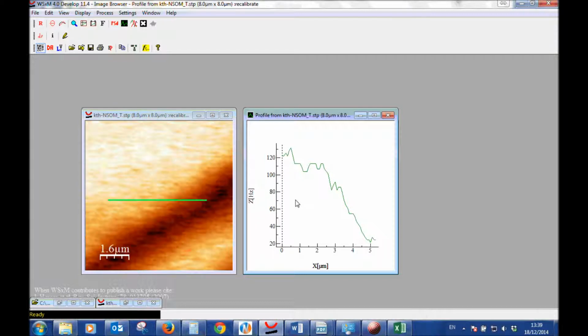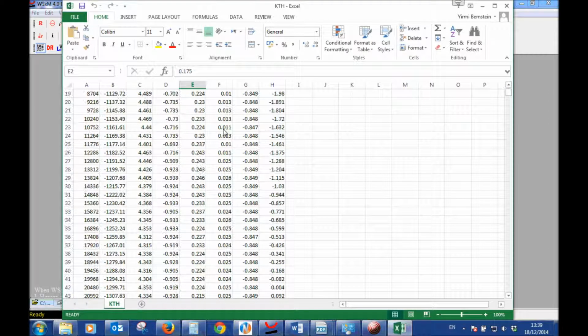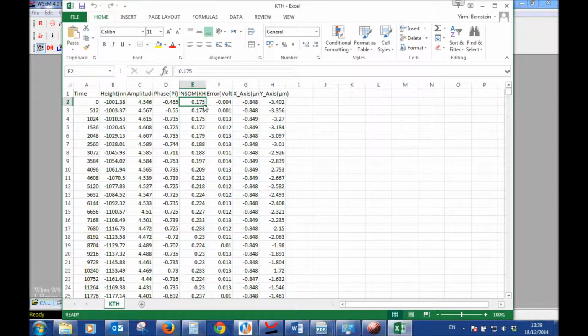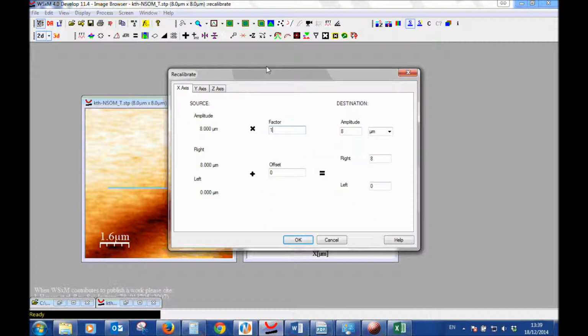Now all we did was make the minimum 0, but we want it to make more sense. So we can just look for the minimum value in this Excel sheet and put it there. For example, you can use a certain function which will look for the minimum, and add that minimum in the same way to here. We can add another offset.